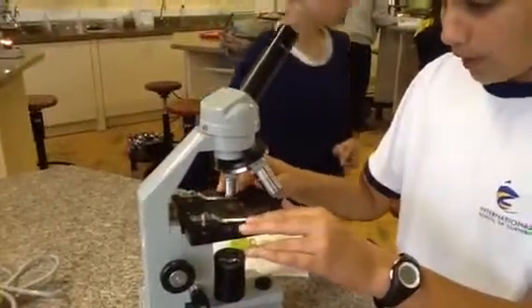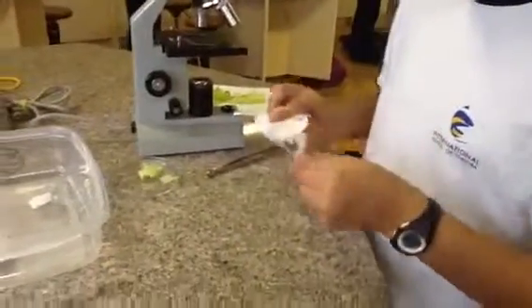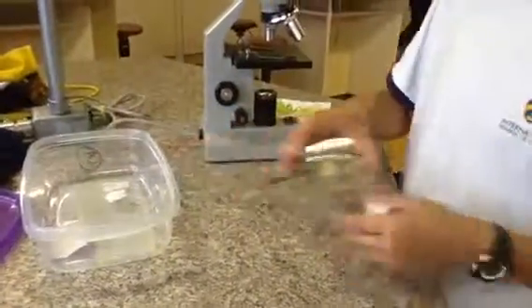So now we must clean up. We're going to turn off the light and set it back to normal because we don't want it to break. Then we're going to remove our slide. We'll take out a napkin, get rid of our lettuce, put it on our petri dish, and then wipe down our cover slip until it's not wet or dirty anymore. When that's done, we put it back, dry it up, throw out the stuff in our petri dish, wash up the water, and then unplug.